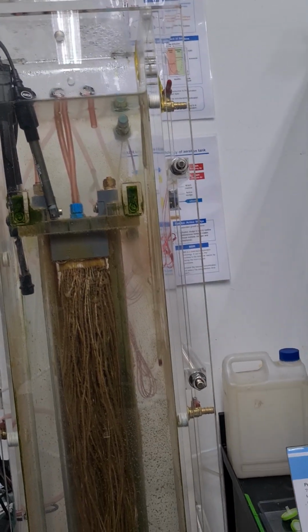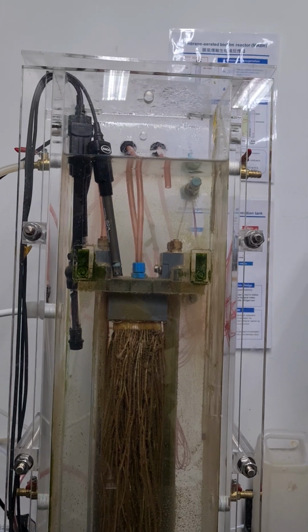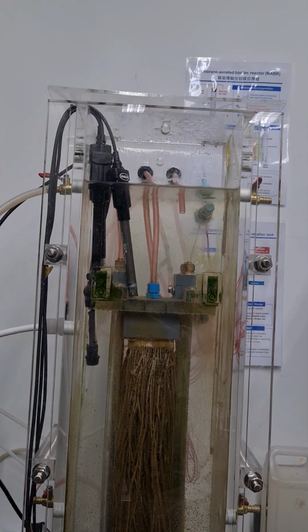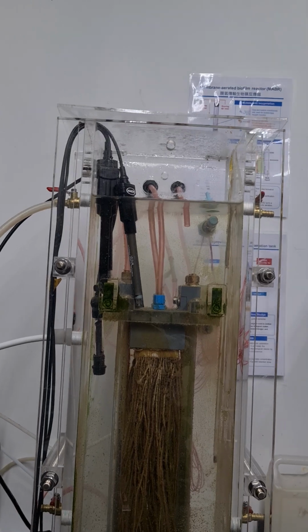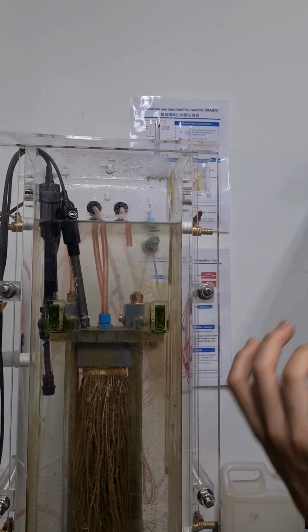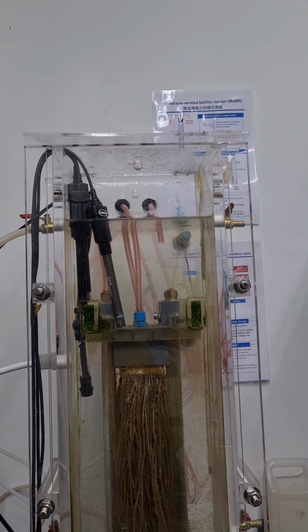So it's still under operation? Yeah, sure, it's still going on. It looks like the water quality is good, it's very clean, right? Yeah, and also as you can see, there's no suspended sludge. Only biofilm in the MABR. The only biomass is biofilm. And in this case we can reduce the waste sludge production, so we don't need to dispose of it.